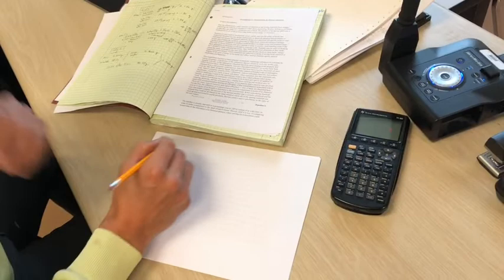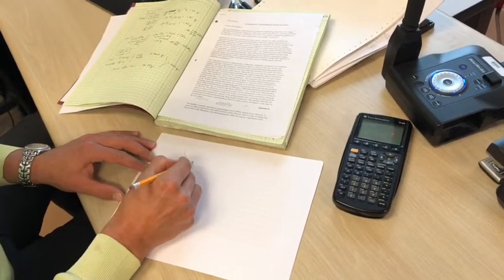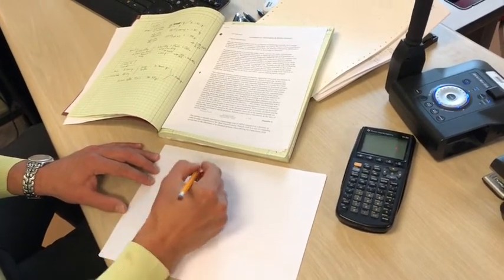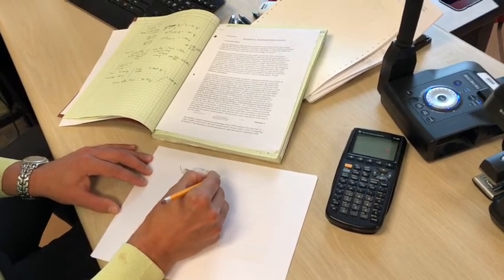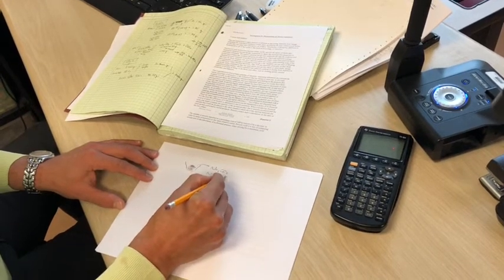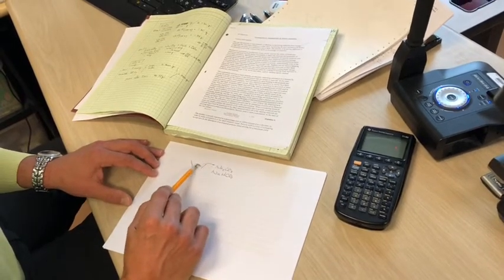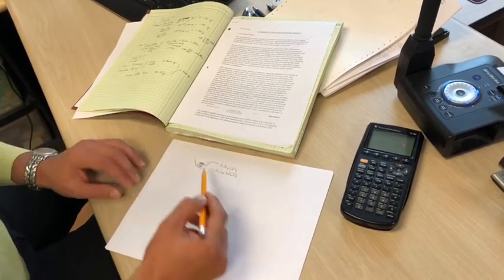All right, everybody. So in the lab today, what we have to do is we're given a mixture, and this mixture we place in the crucible is sodium carbonate and sodium bicarbonate. So our job today is to figure out what's the percent of sodium carbonate in the mixture and the percent of sodium bicarbonate in the mixture. So we want to know what's in there.